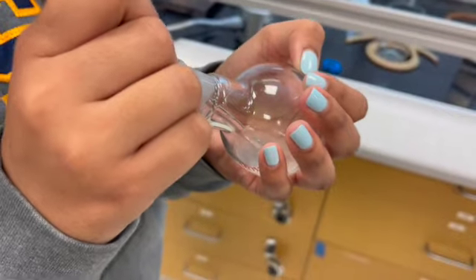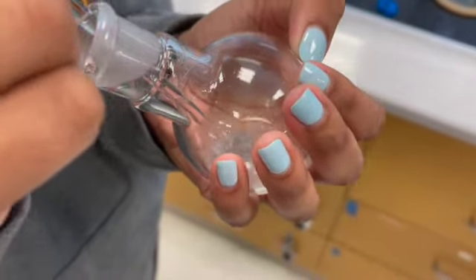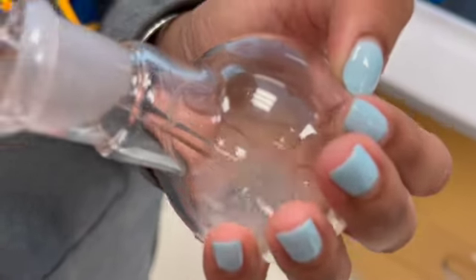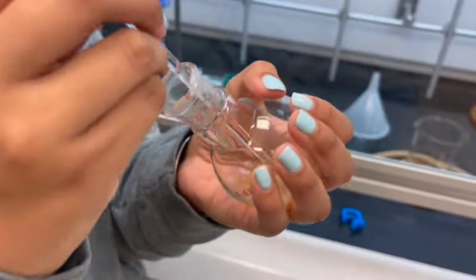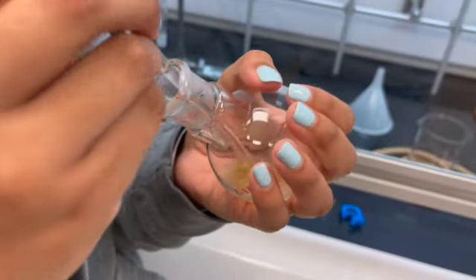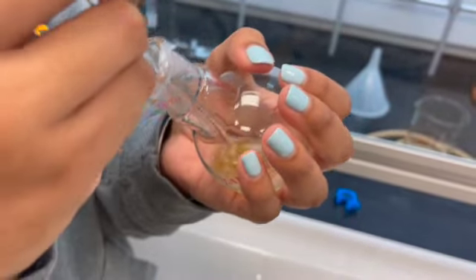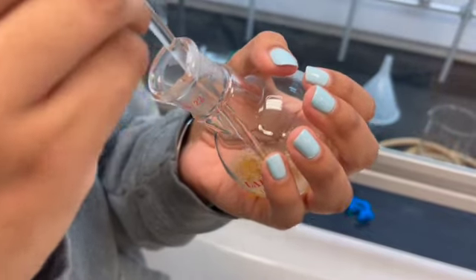As we continue with the stirring and breakdown, we have to wait till it becomes more cloudy. As you can see it has become cloudy. Aside from the boiling, you can also feel how the reaction is becoming hotter, so the temperature is rising and you can smell a chemical-type smell. It's boiling now.